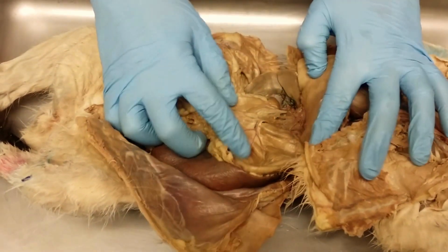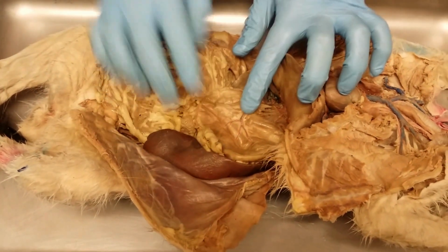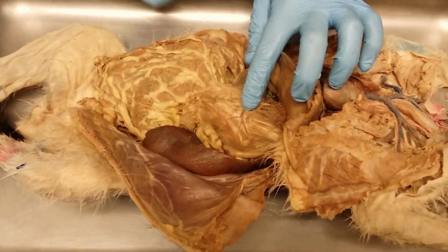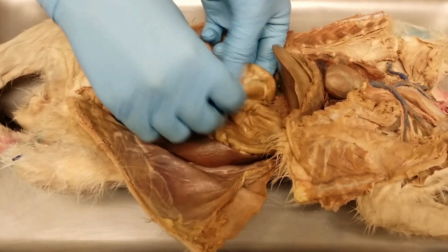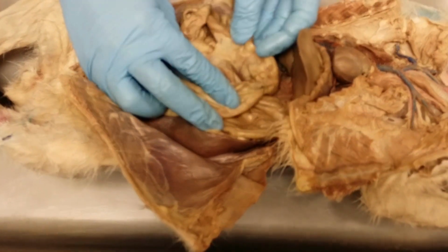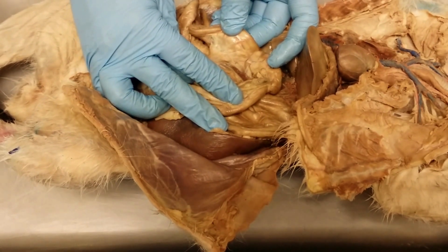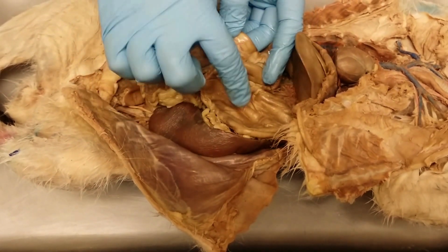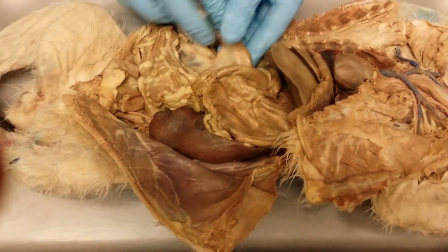Attached to the lesser curvature of the stomach, if you see all this fat embedded right there, okay, this is the lesser omentum attached to the lesser curvature of the stomach. Coming directly off of the stomach, where we start to see the small intestine, this is what part of the small intestine? Duodenum. So if I ask the small intestine and it's close to the stomach, in really close proximity to the stomach, it would be the duodenum.